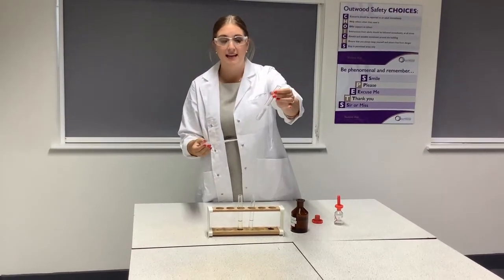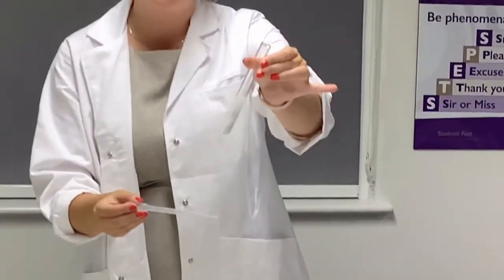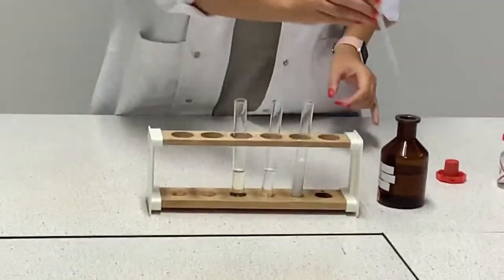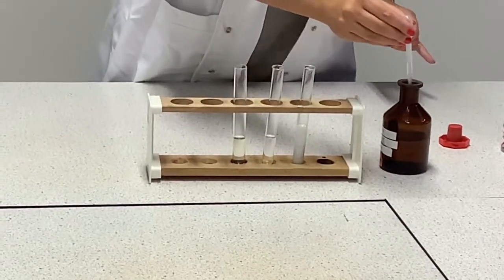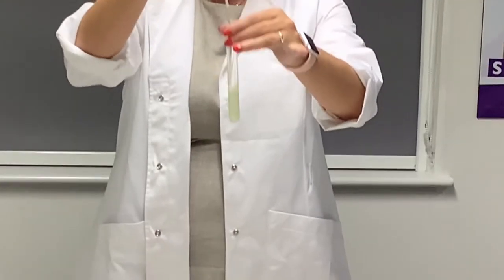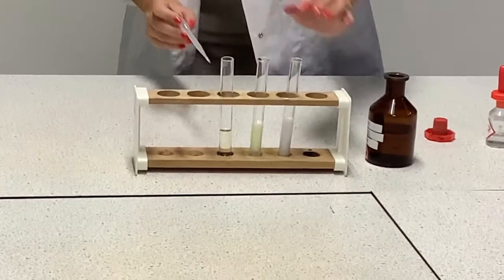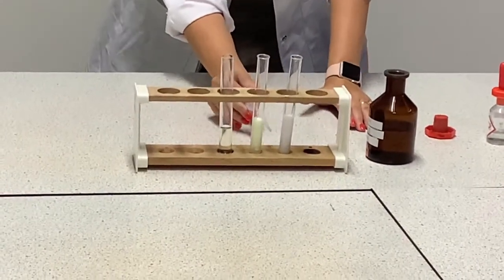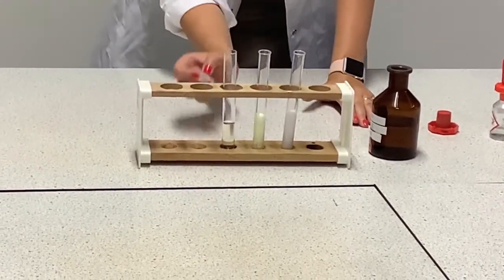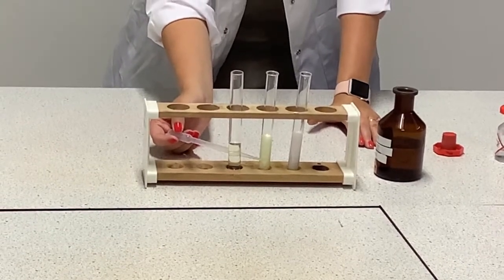We can see a white precipitate has formed — that is silver chloride. Now if I add it to bromide, we should see a different colour precipitate form. It is very pale, so I'm going to put it next to the chloride so you can see it's slightly darker. We say that this is a cream precipitate.